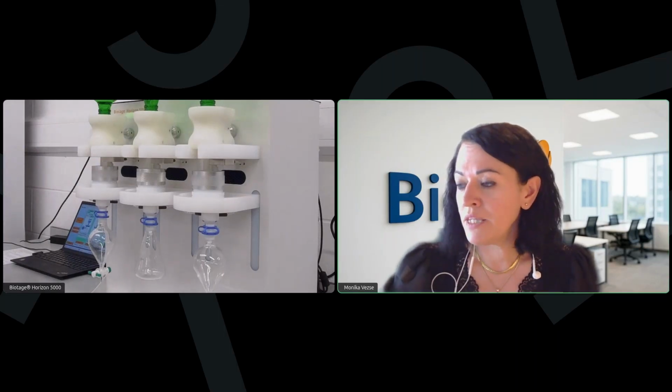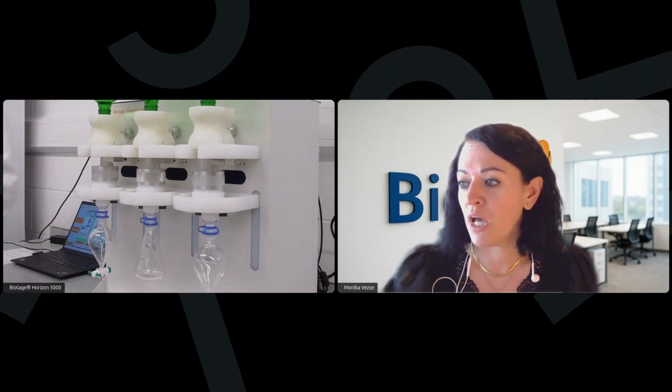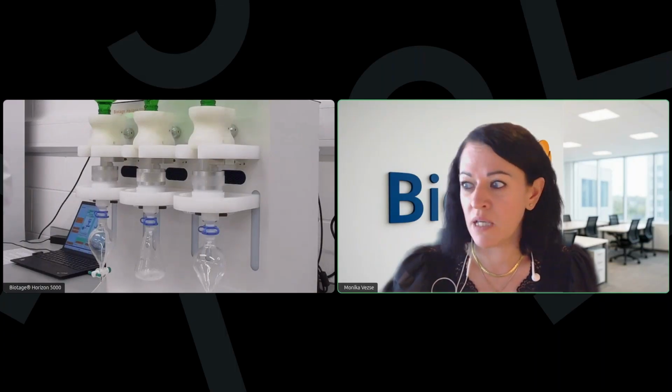And then there was also a question on EPA 525.2, whether the system can be used for the application for that, and the answer to that is also yes. We have an application note number 950, which describes the EPA 525.2 method as well.